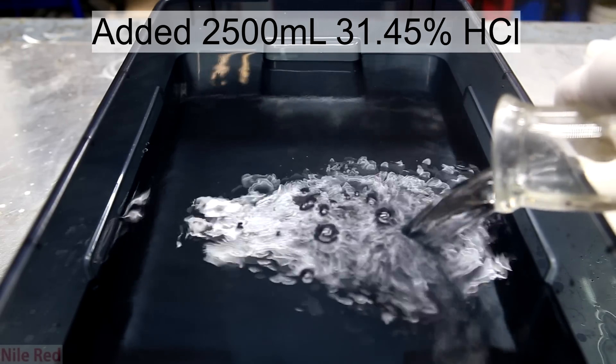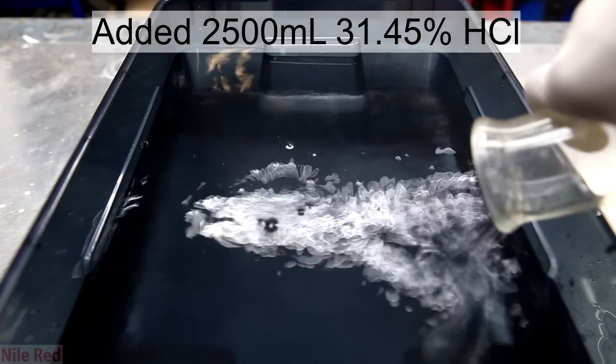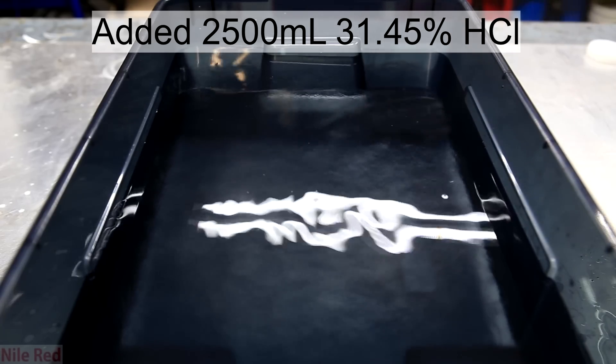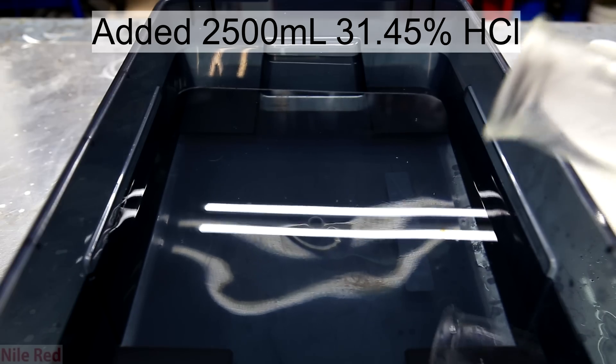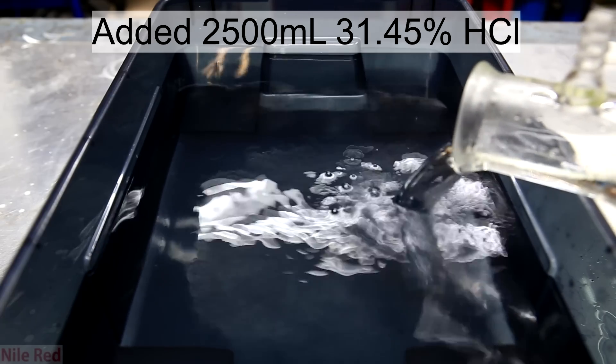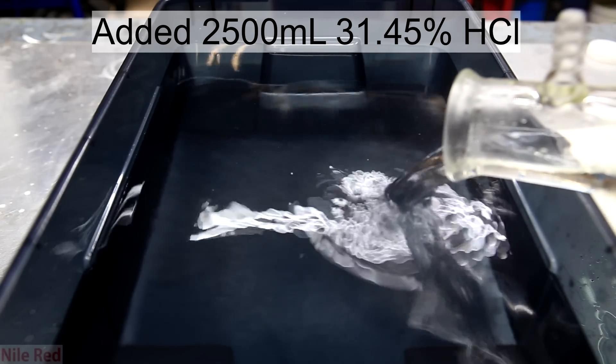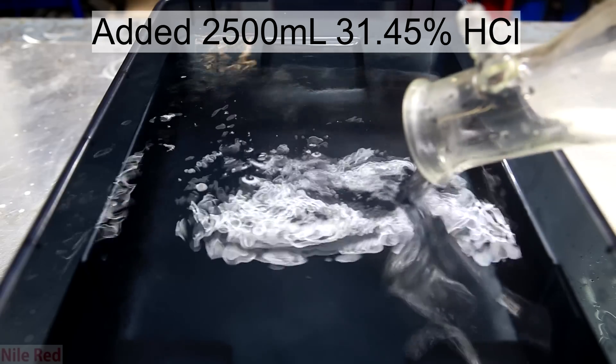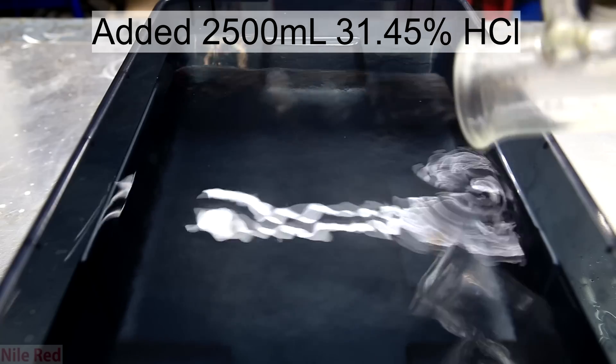It is generally important to remember the rule that you add acid to water and not the other way around. Technically in our case, since we're using hydrochloric acid which is 70% water, this rule isn't extremely important, but in general you should follow it just for safety purposes.